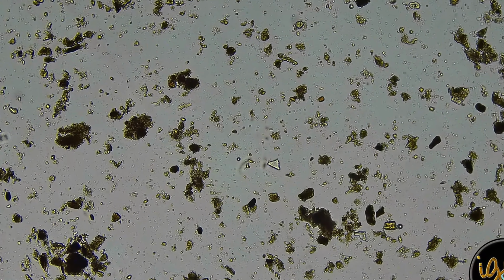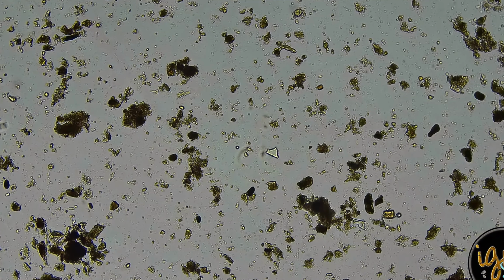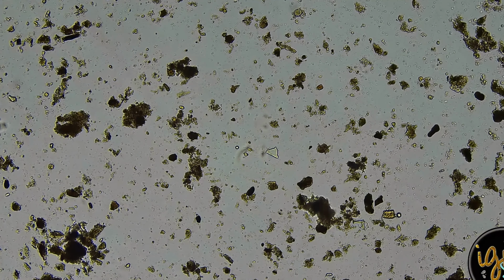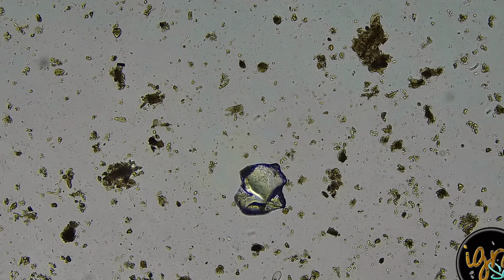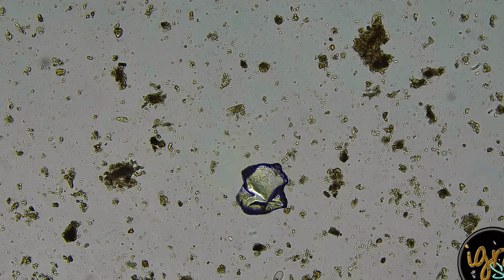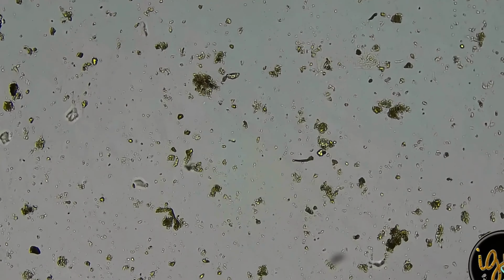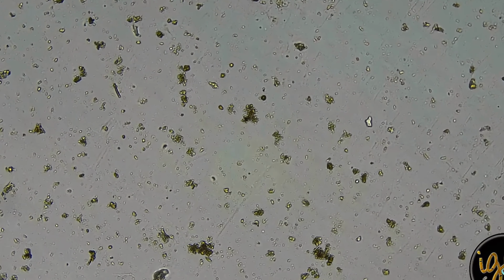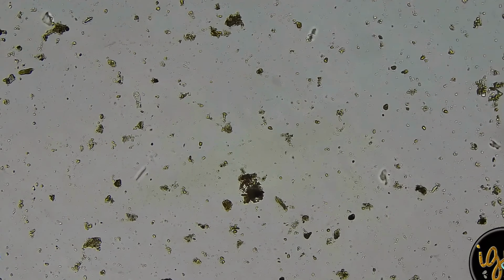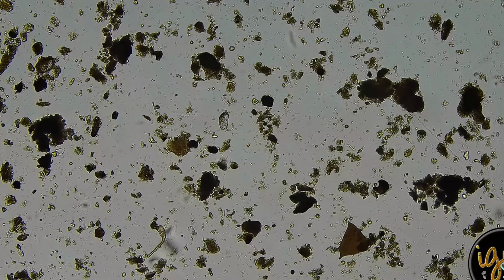This here is sand, usually. These glass-looking shards, they're usually sand. And we deal with a lot of that here. Well, this is more like sand. Sorry. That is usually what it is. It could be other minerals that I just wouldn't be able to identify. Unfortunately, the keys to identifying minerals is a whole special type of microscopy.